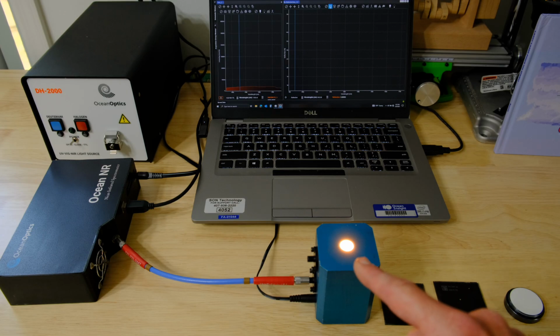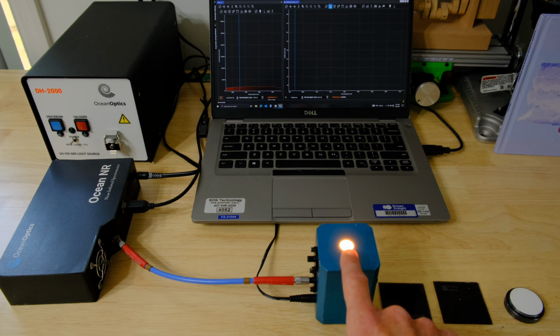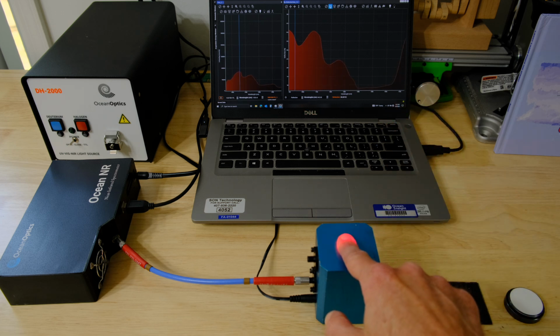And with the integrating sphere, we're getting more of an average measurement over the whole area of this port. So anything that's covering this illuminated port contributes to the reading that we ultimately see up on the screen there. So if I cover it with my finger, we're getting some trends in the NIR that have to do with my finger, skin, and blood and all that there.